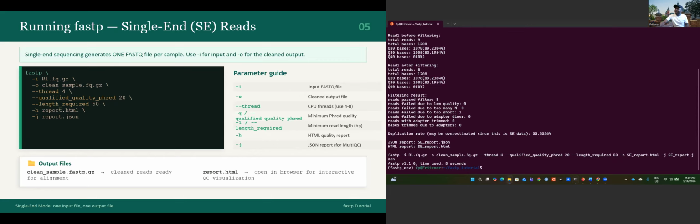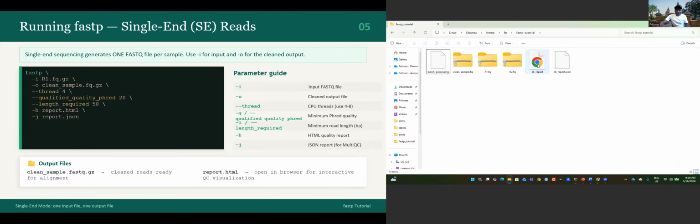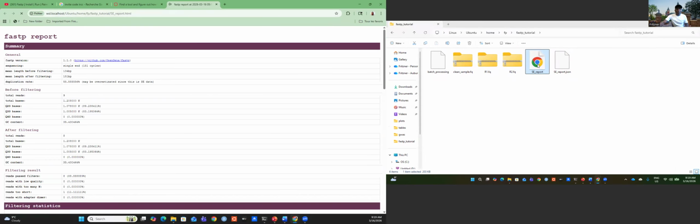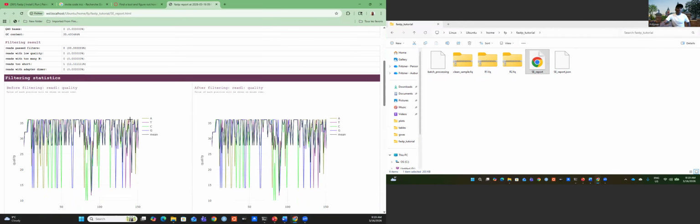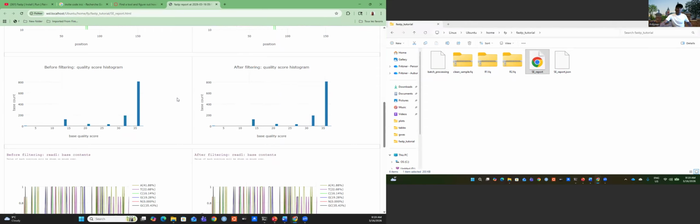Let me just open it for you. I hope you can still see that. This is the single end HTML report. This is the report that is generated. It's a nice report with a lot of graphics. This is the filtering statistics, before filtering and after filtering. It's just a nice report.